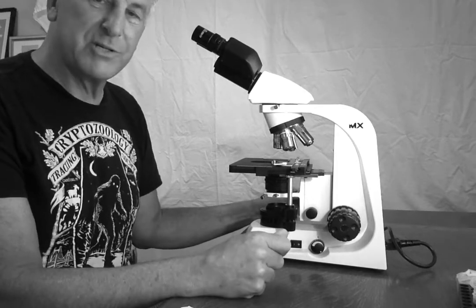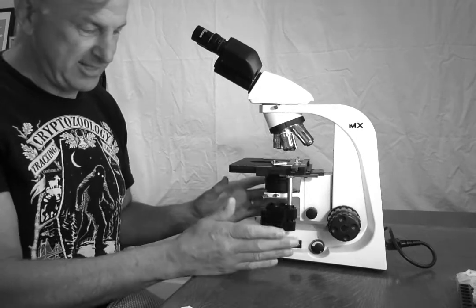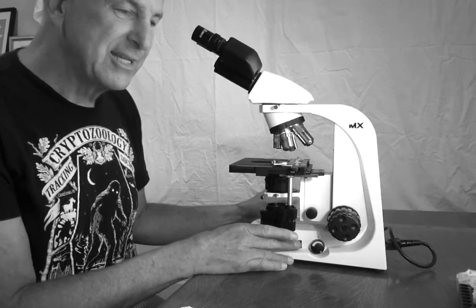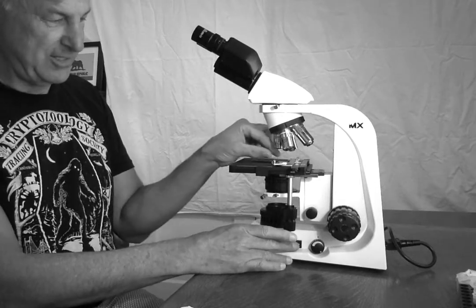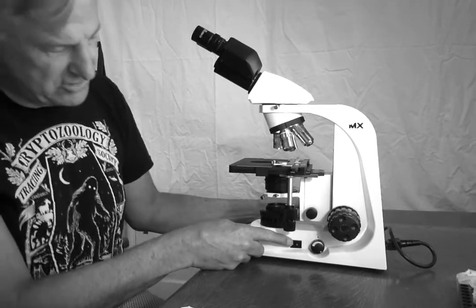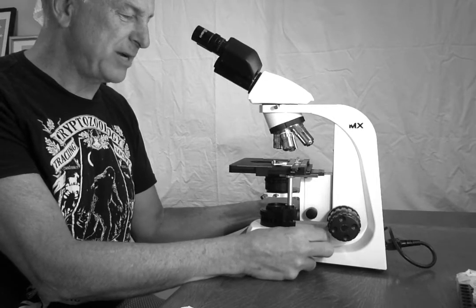Next, what will we start with? We don't start with observing. We start with what's called Koehler illumination. This is optimizing the light source so it works best, centering what's called the condenser, which condenses the light and aims it through your sample. So first of all, let's turn this thing on. The light switch. Another important thing in illumination is the rheostat. This makes the light brighter and dimmer.